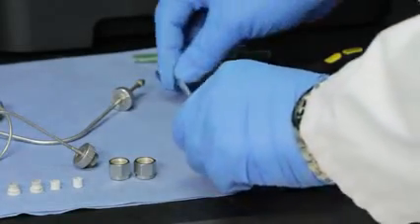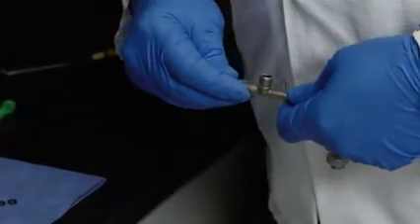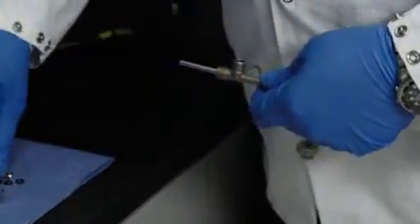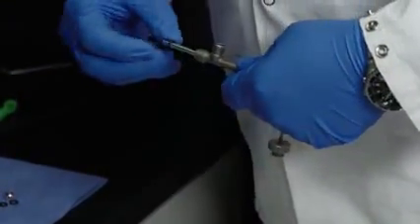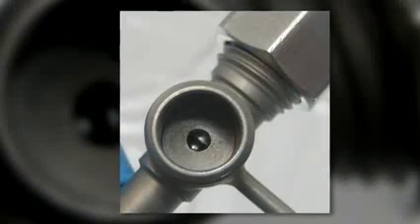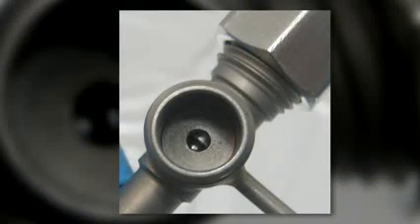Assembling the heater tube is easy. Insert the heater tube into the test section with the engraved end of the heater tube up towards the test section outlet fitting, then assemble the ferrules, o-rings and locking nut, and line up the heater tube shoulder with the center of the hole in the outlet. Now repeat the process on the other end.